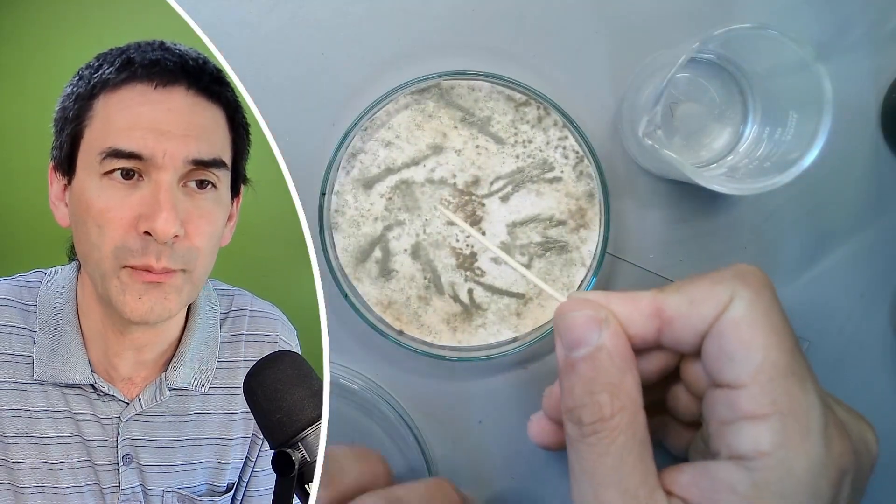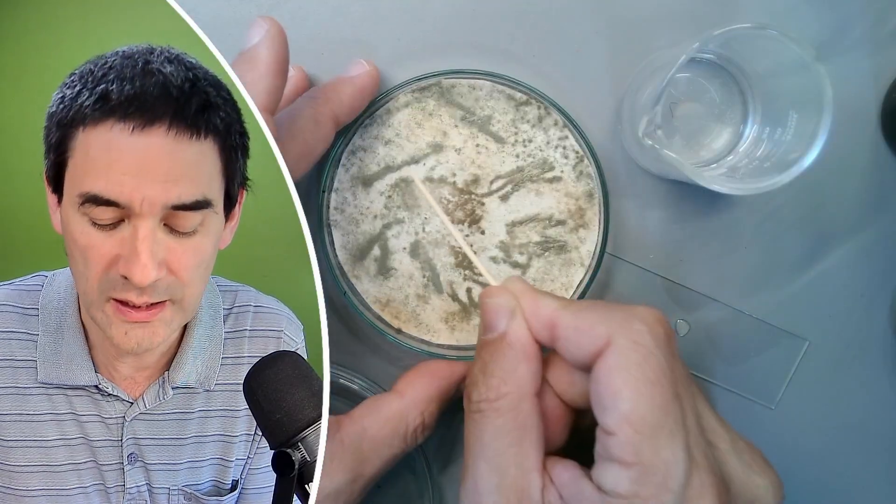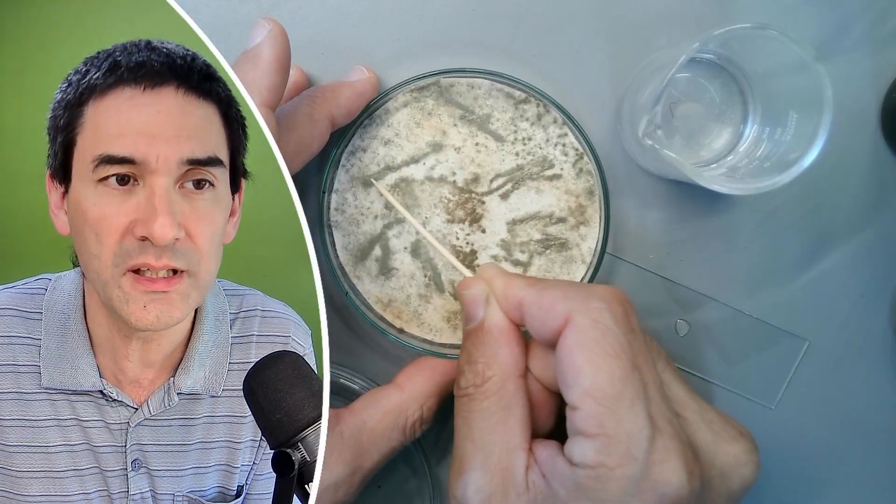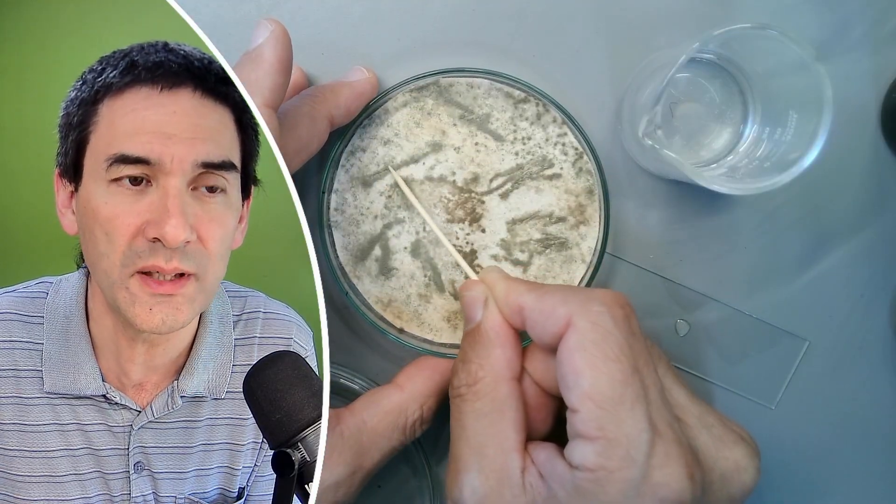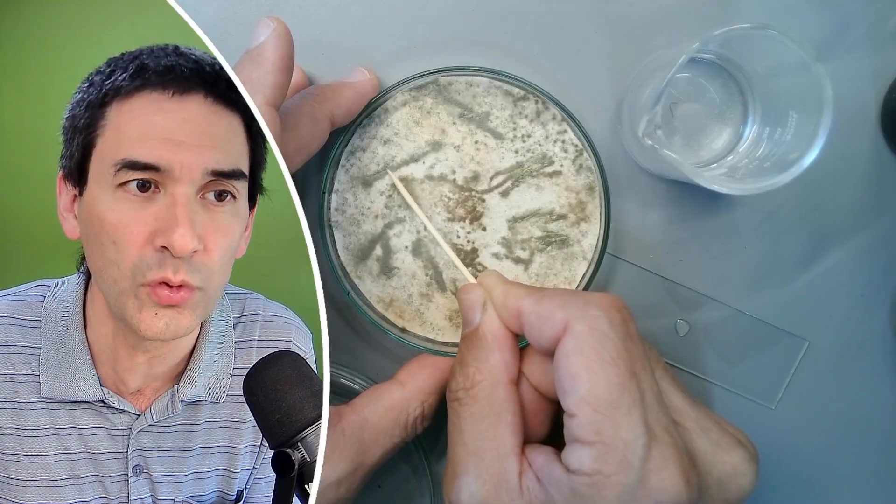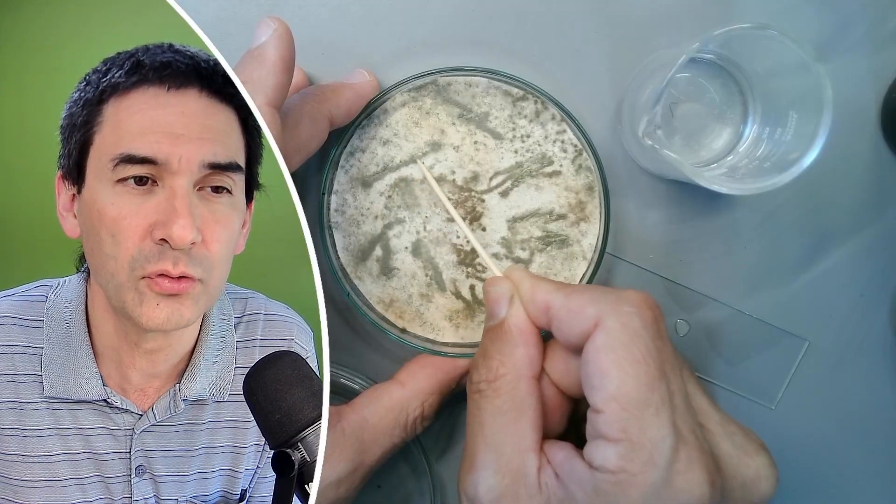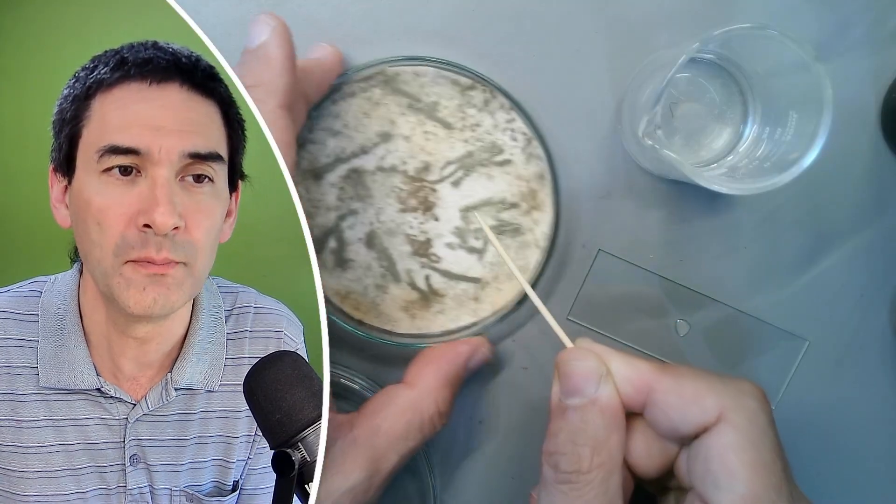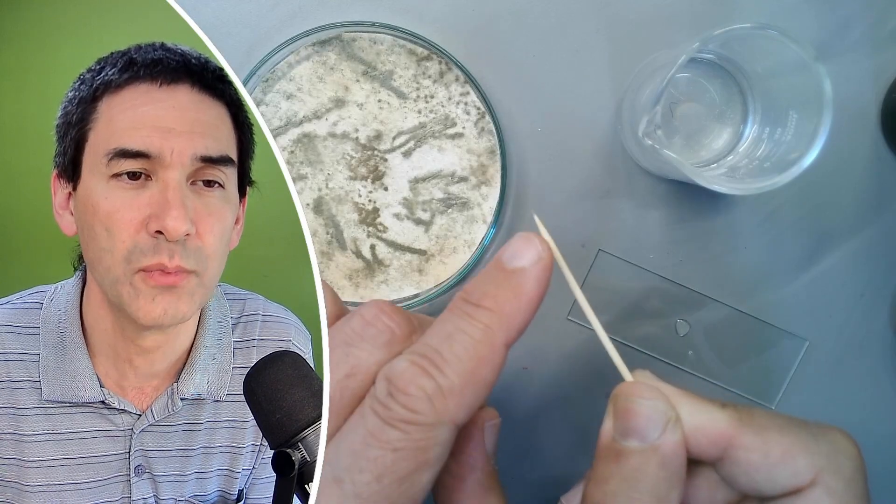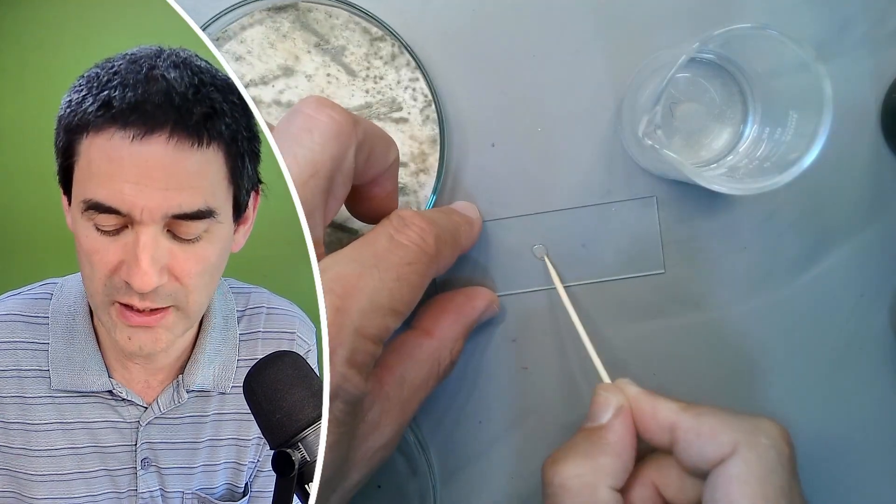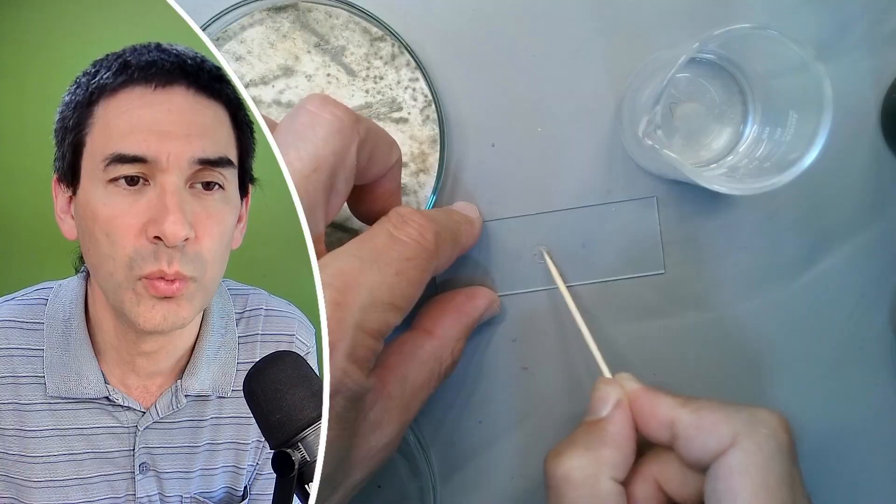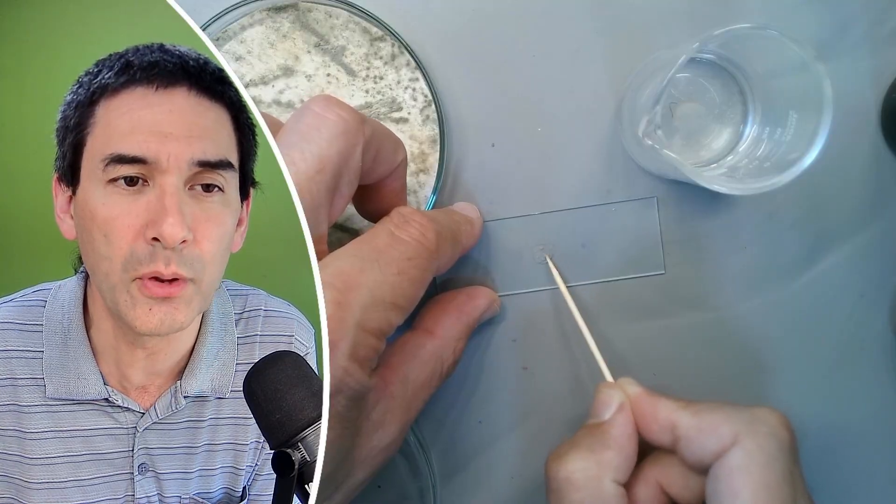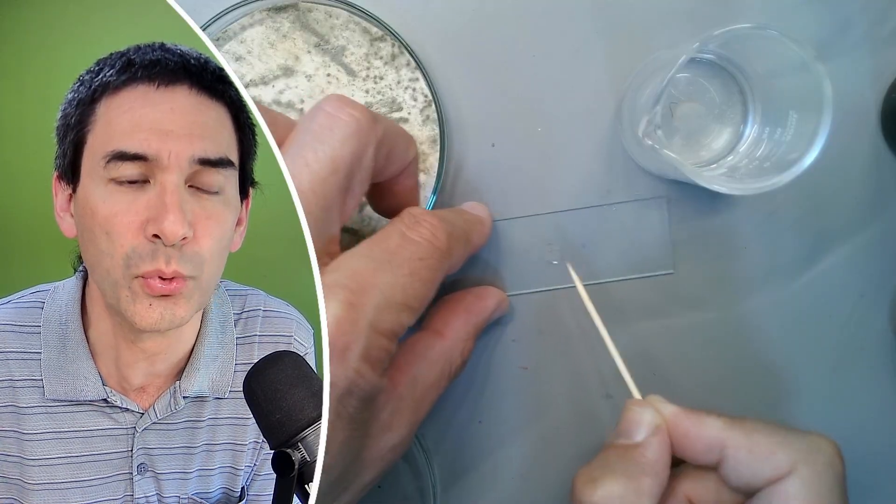How I've actually grown the mold here, that is a different story. The mold here is actually one that starts to attack citrus fruits like lemons and oranges and I've grown them here on some filter paper. Maybe you see a very small, it's dark green and gray so this should actually be enough. You want to mix it a little bit to break apart any clusters of spores.